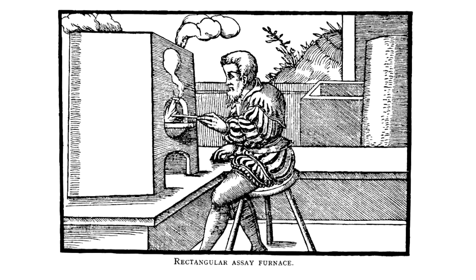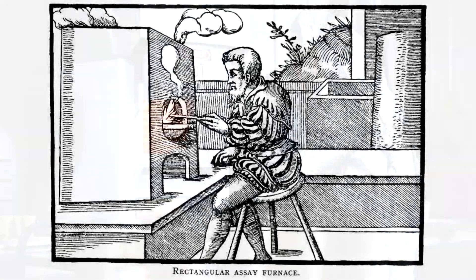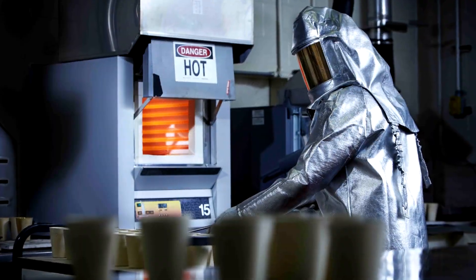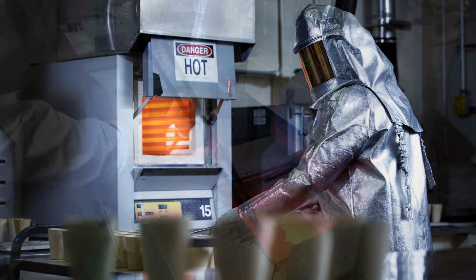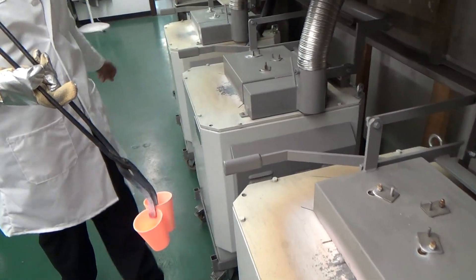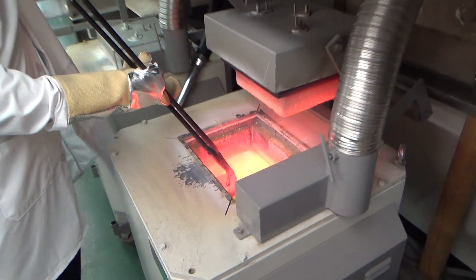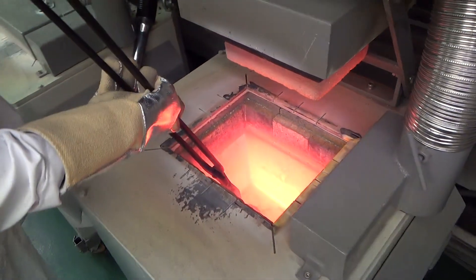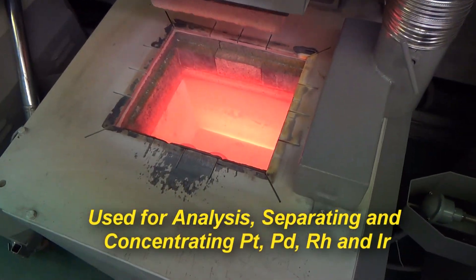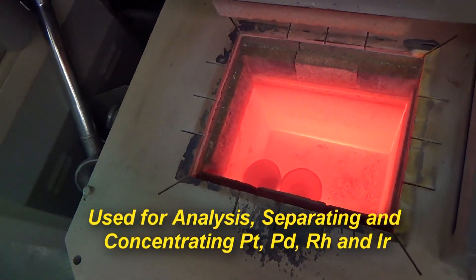Fire assays are still routinely performed on gold and silver ore samples. It is also used for the analysis of secondary or scrap materials, as well as for separating and concentrating platinum group metals, with the exception of osmium and ruthenium.